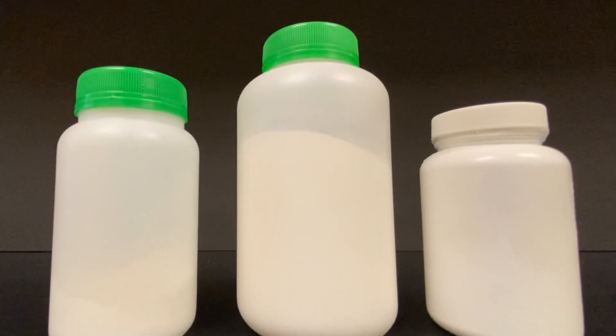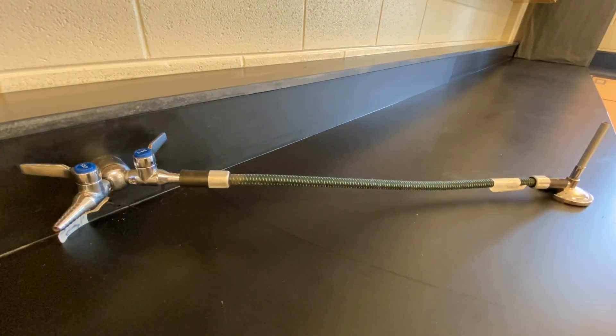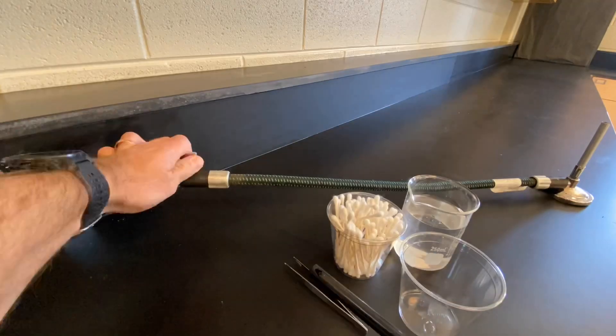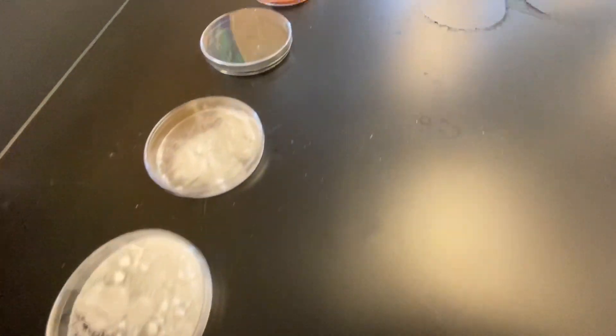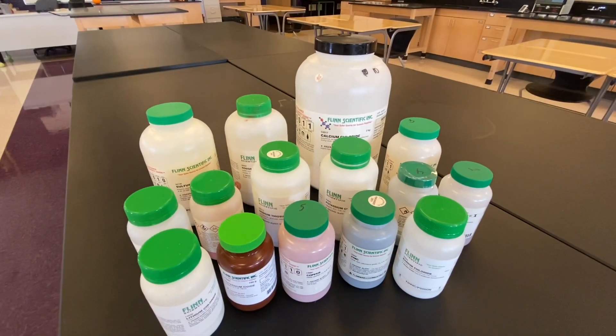It's really important that we identify what those three unlabeled chemicals are. Luckily, we think you can help. Here in my classroom we set up a station complete with a Bunsen burner, a beaker, and various Q-tips, and we're going to do a flame test with all 15 chemicals we have in our cabinet. We take inventory of all chemicals here at Sycamore Middle School of Science, so we know these three unlabeled chemicals had to come from one of those 15 labeled containers — we just don't know which one.